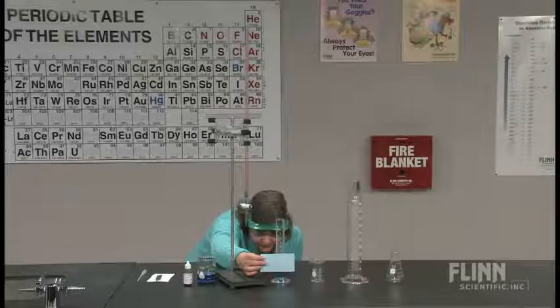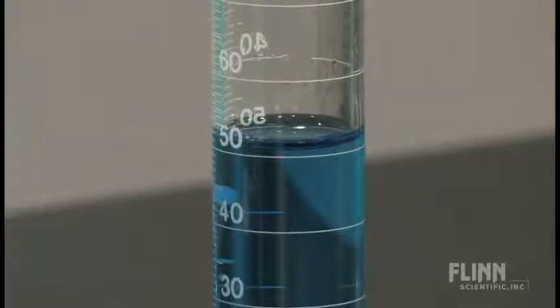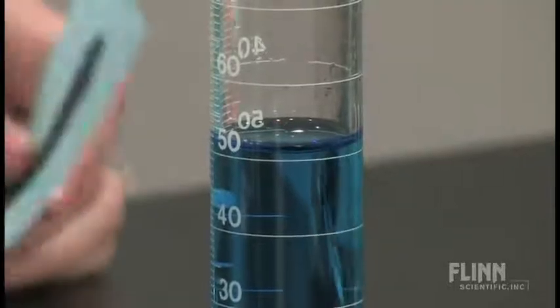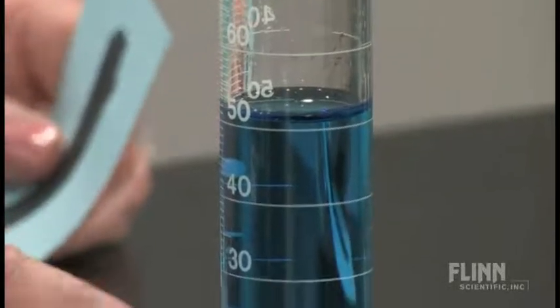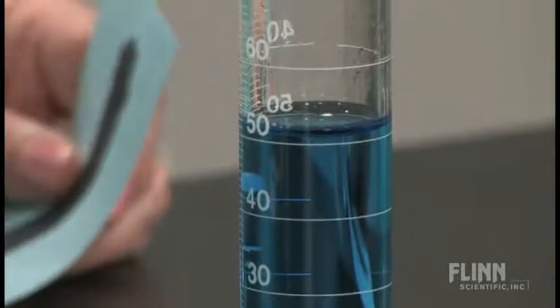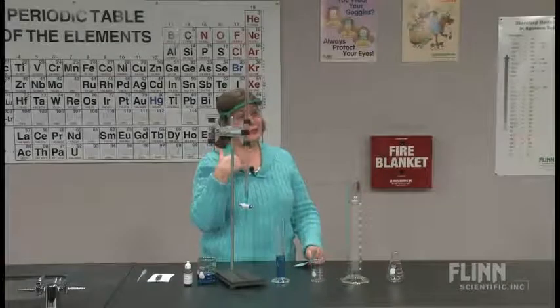And I'm reading 50. Now here you've got to also look at what your markings are. And this is what the students have to learn when we said you have to teach them how to read. How do you read a graduated cylinder? The major markings are 10, 20, 30, and so on. So then the minor markings are 1, 2, 3, etc. And so I need to estimate in between those.